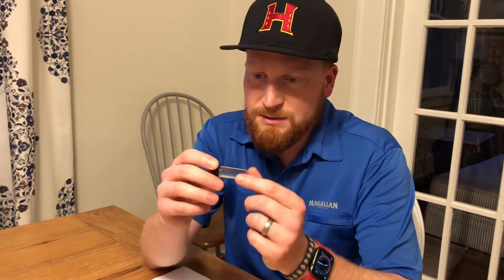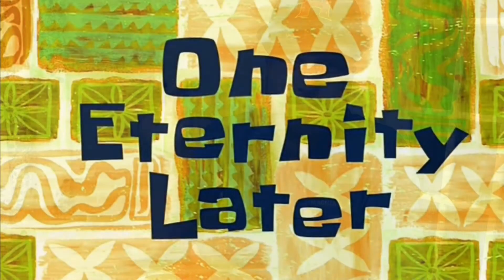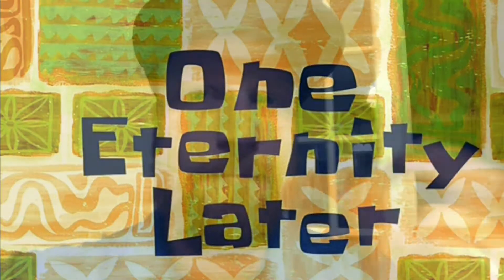Now what you gotta do is dissolve these tablets. Finger on the cap, finger on the bottom, and shake it. This is gonna take like five minutes. All right, I think we're done shaking — it's been five minutes by my watch. So I'm gonna check it now.